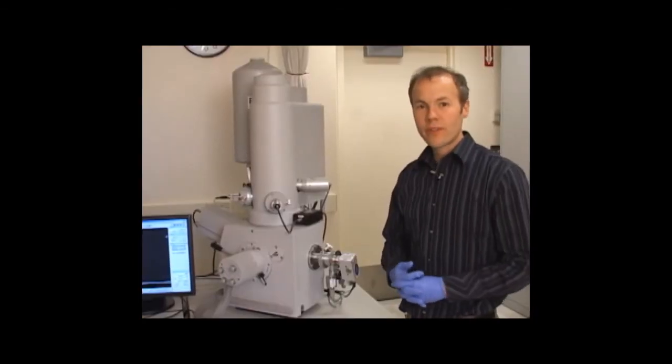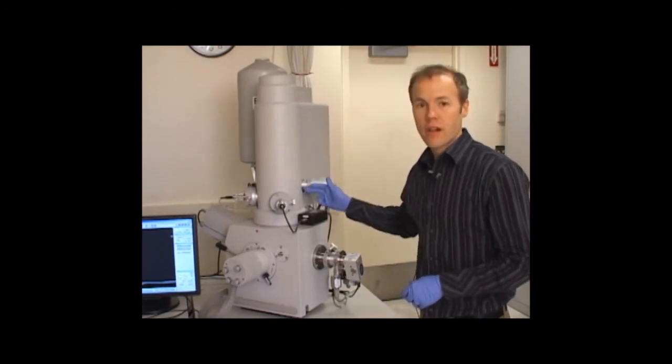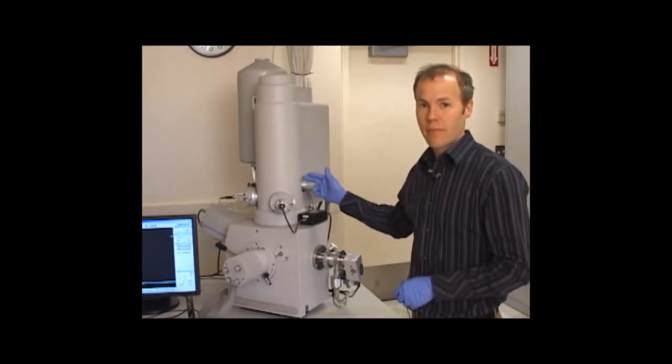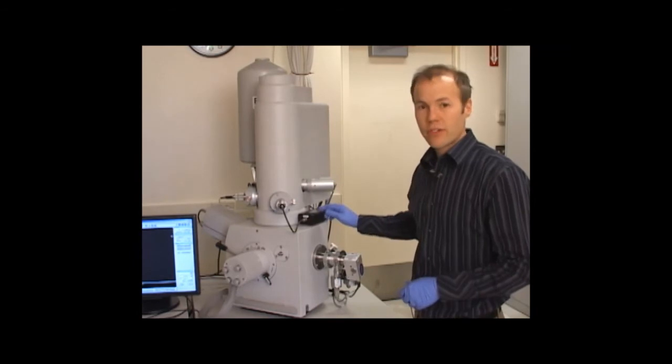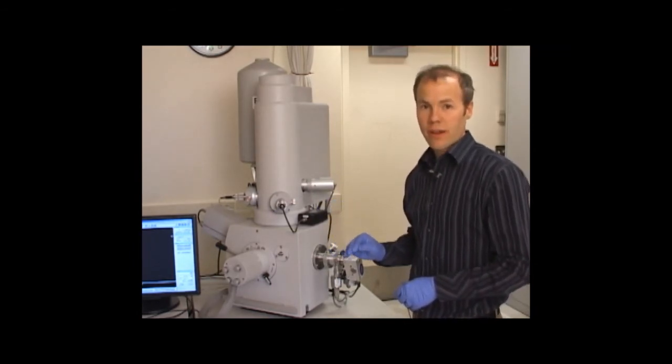When we execute the run file, the NPGS computer is going to position the beam in the column using the scan coils on the SEM. This is the external beam blanker, which is also going to block the beam when it goes across parts of the pattern that are not exposed.